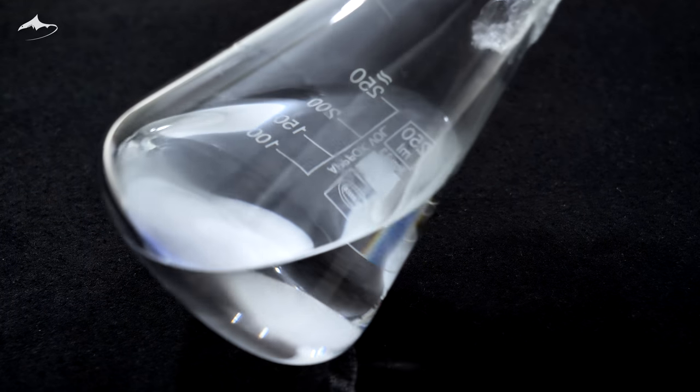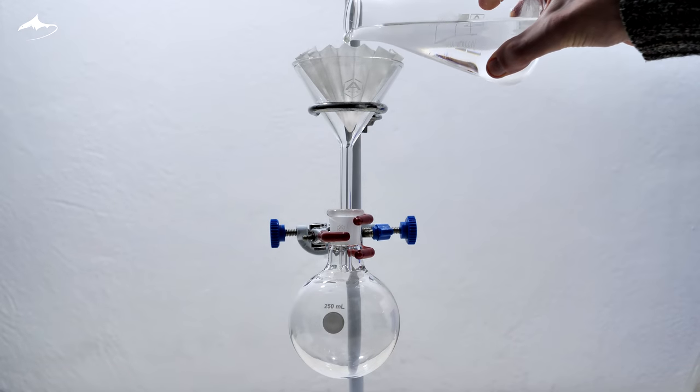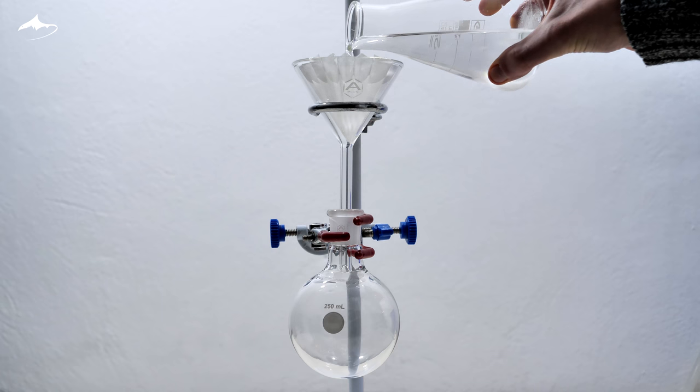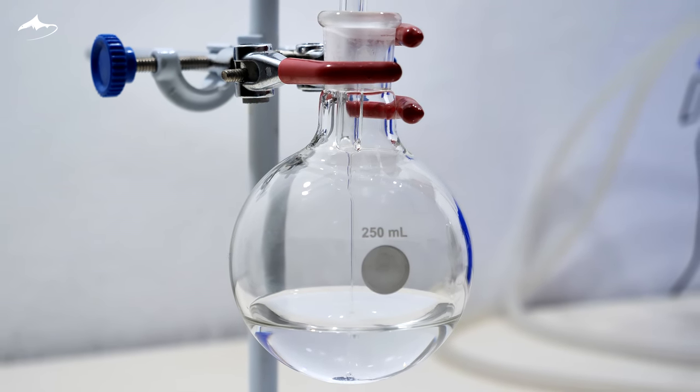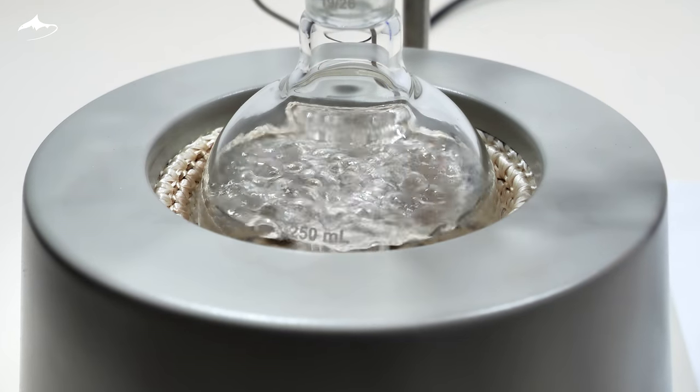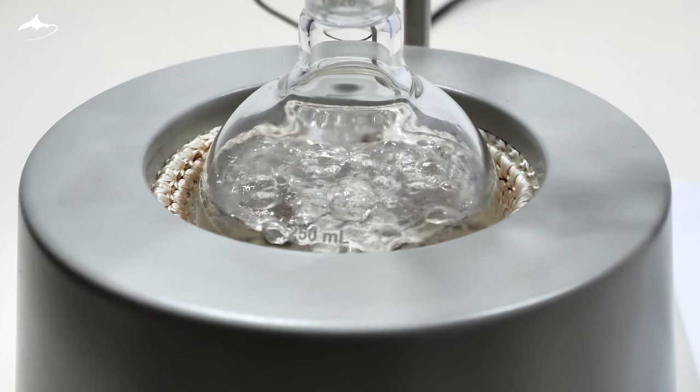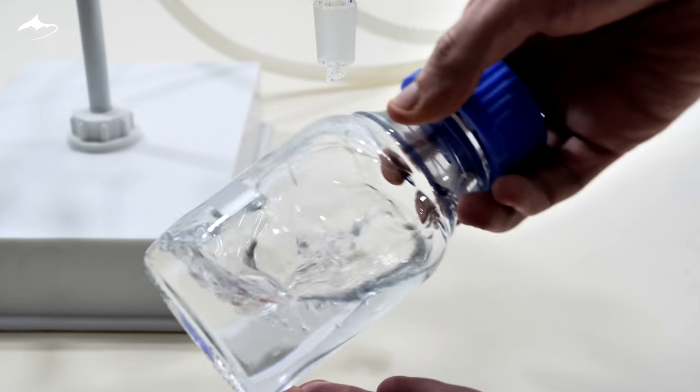After a few hours the drying agent was removed by gravity filtration and the butanol was distilled again. Finally, I got a much better grade alcohol to start with the synthesis.